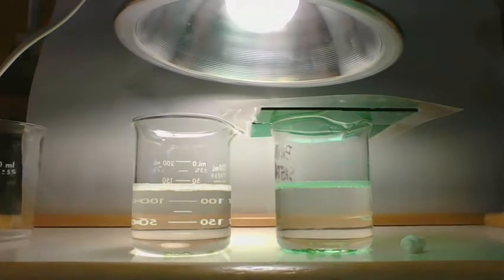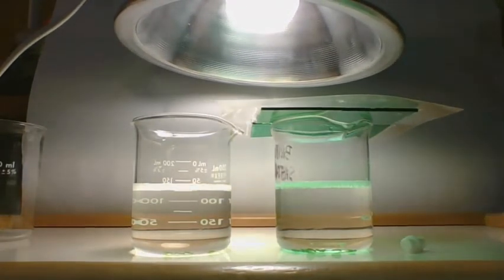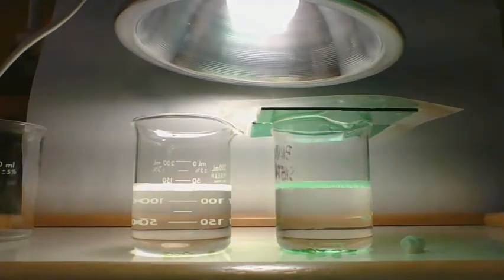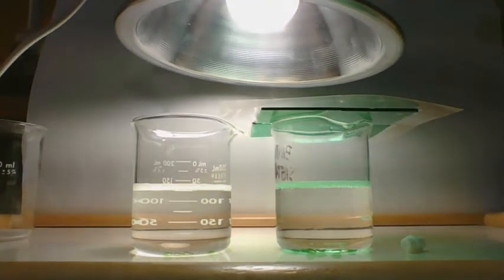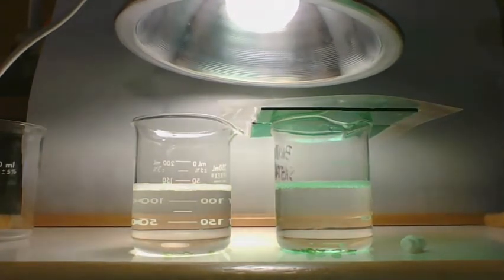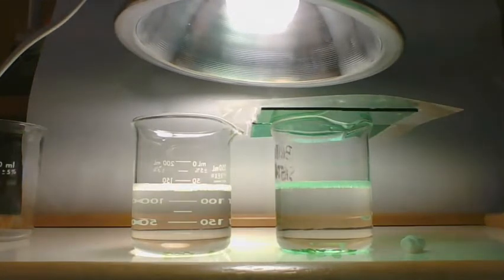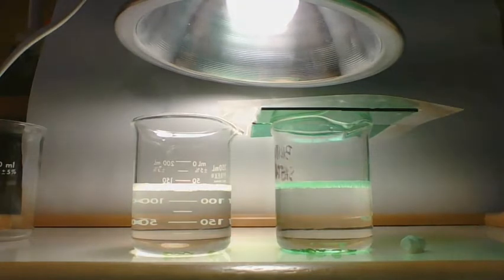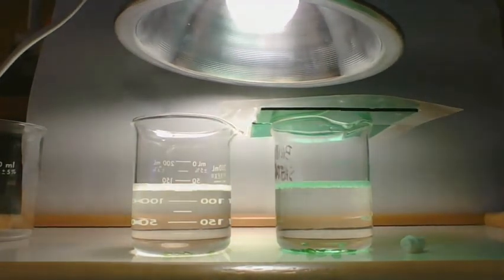Okay, so I'm getting close to a minute. When we get to 1 minute, I will let you know how many are floating, and you will write it down. If you see them floating up, that's great. My position for these videos is I can watch the video, but not the computer, so I can't see exactly what's going on. At 1 minute, we have 0 floating discs in either container. So put 0 for both.